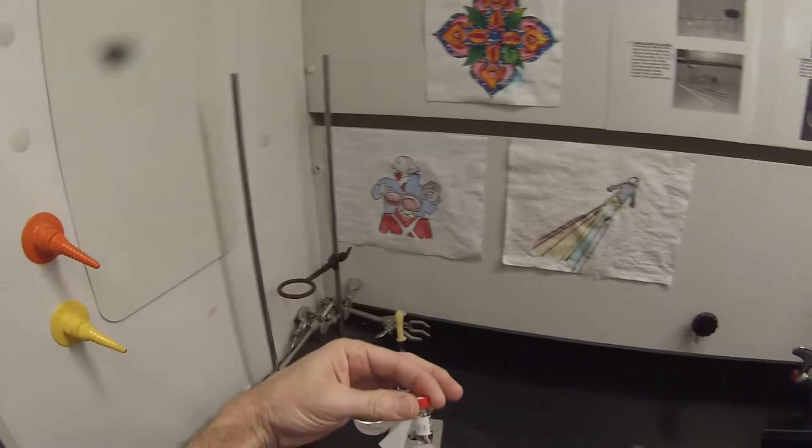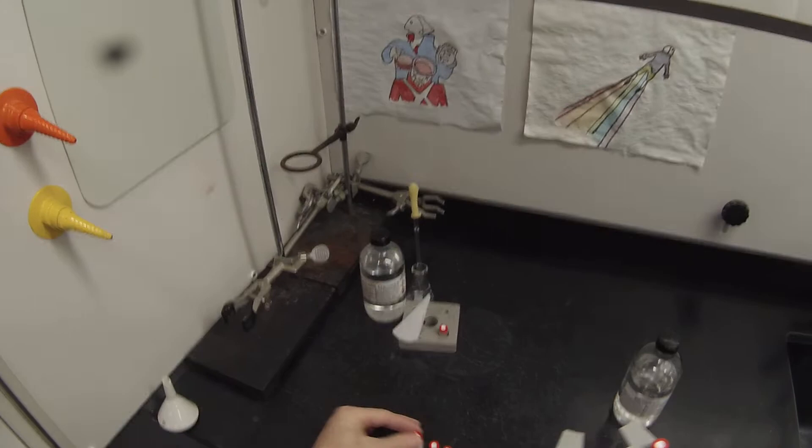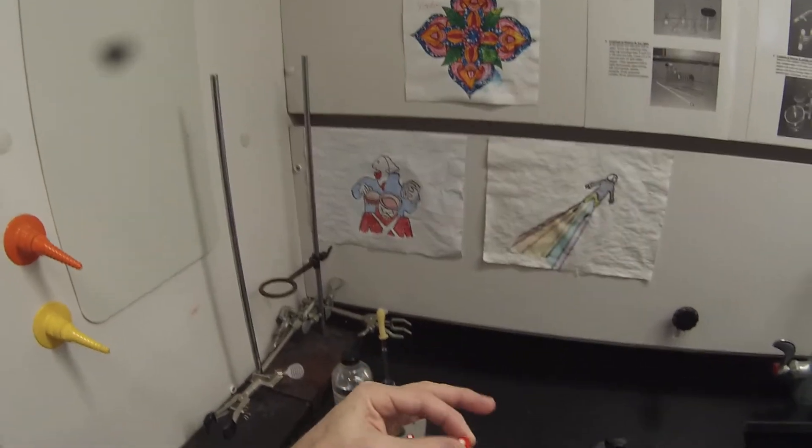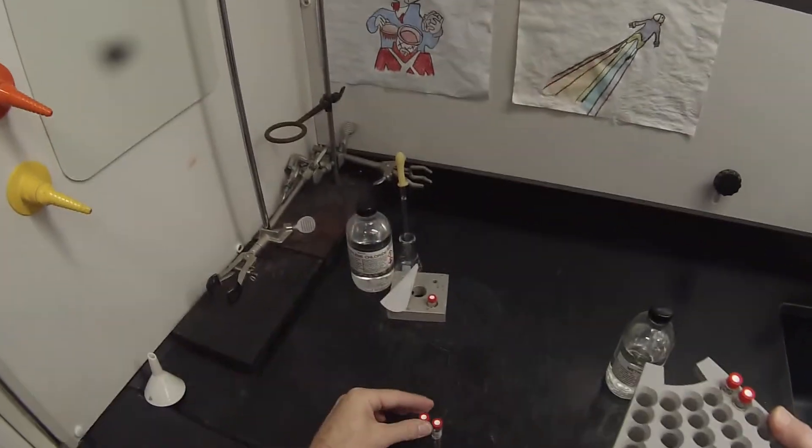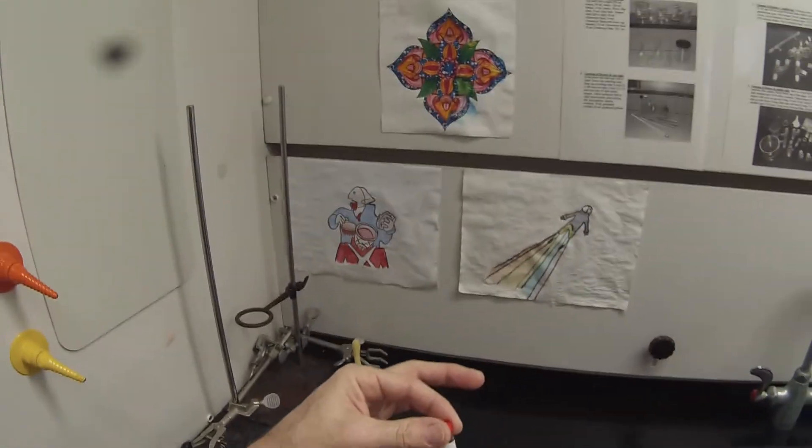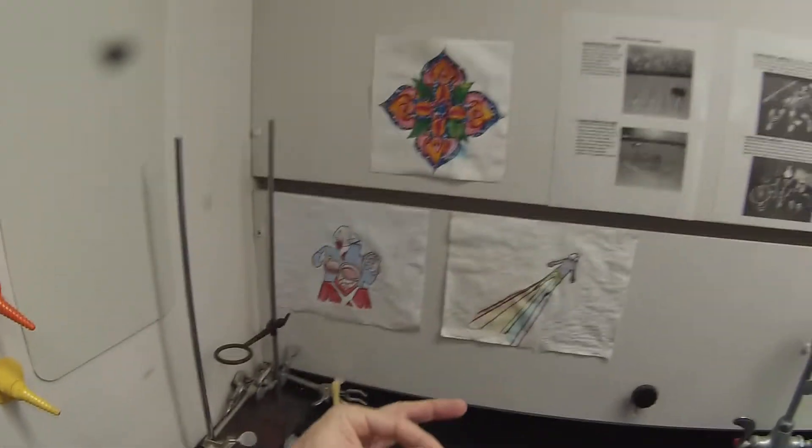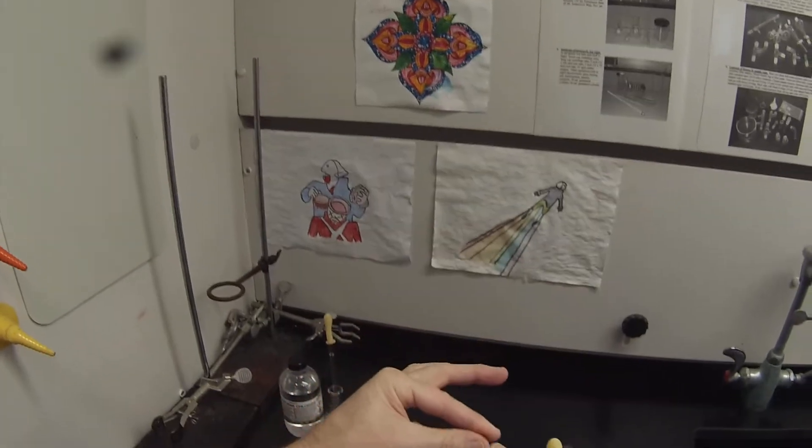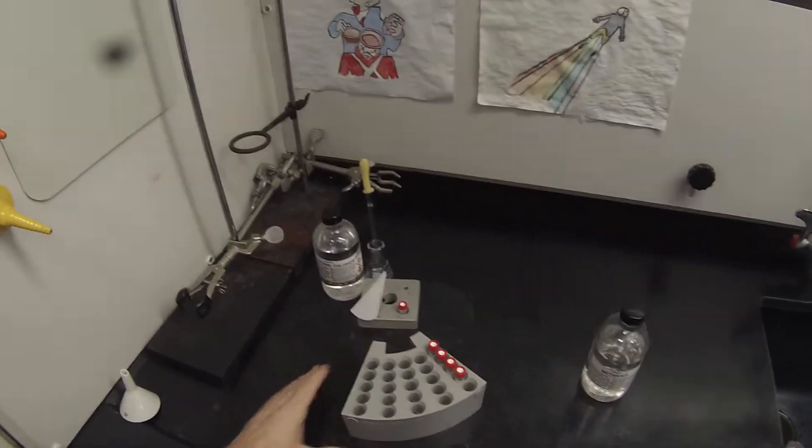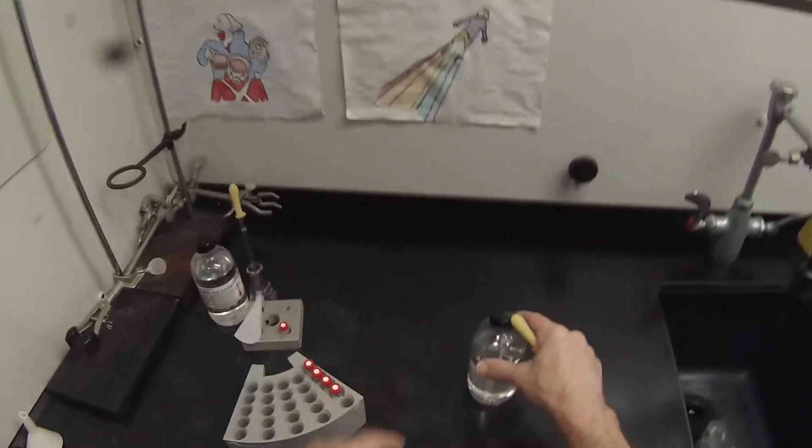And I'm just going to put my samples 48A, 49A, 49B, and 59A in slots one through four respectively.